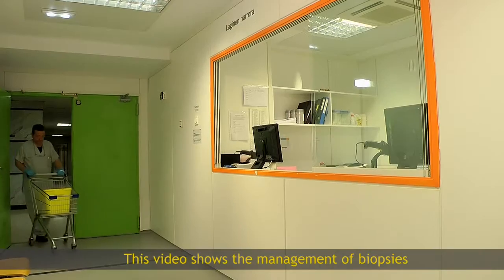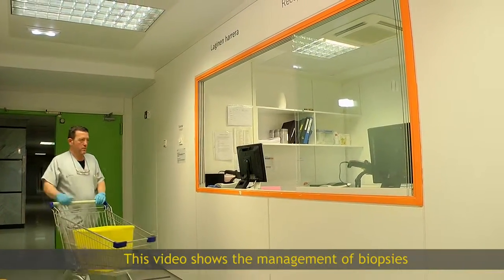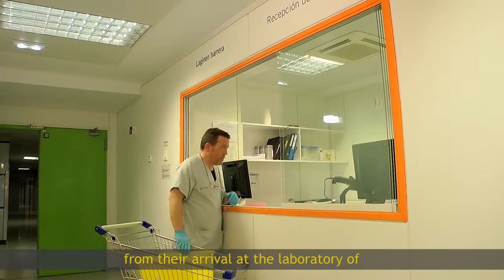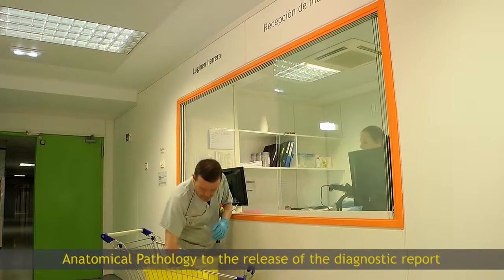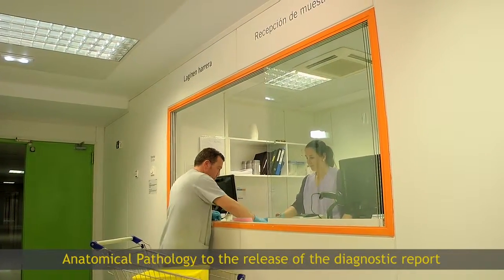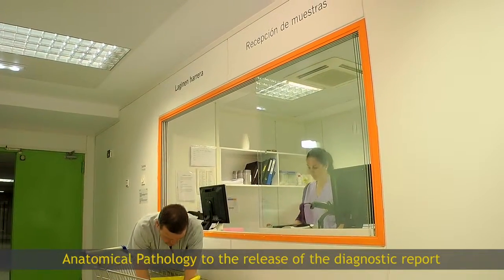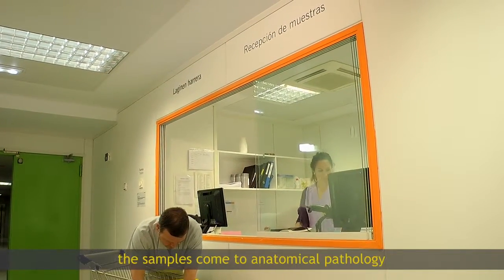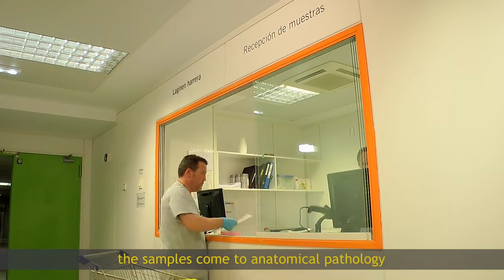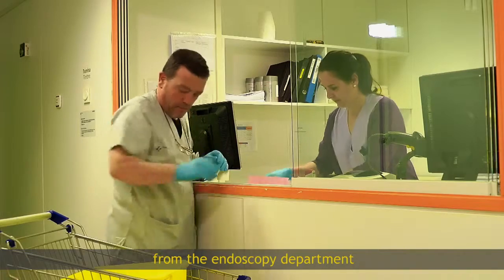This video shows the management of biopsies from their arrival at the laboratory of anatomical pathology to the release of the diagnostic report. The samples come to anatomical pathology from the endoscopy department.